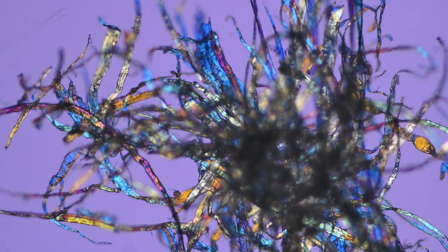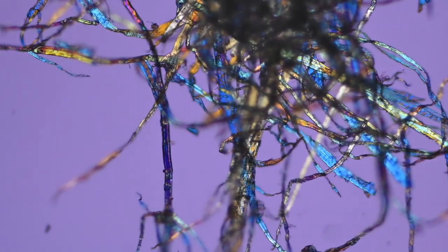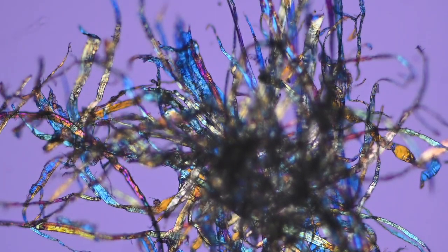I mean, look at this. If I showed you this photo and told you this was just a piece of napkin, you would never believe it. But that's really what it is. And that's what polarization combining with different kinds of filters can do. The effect is really beautiful.